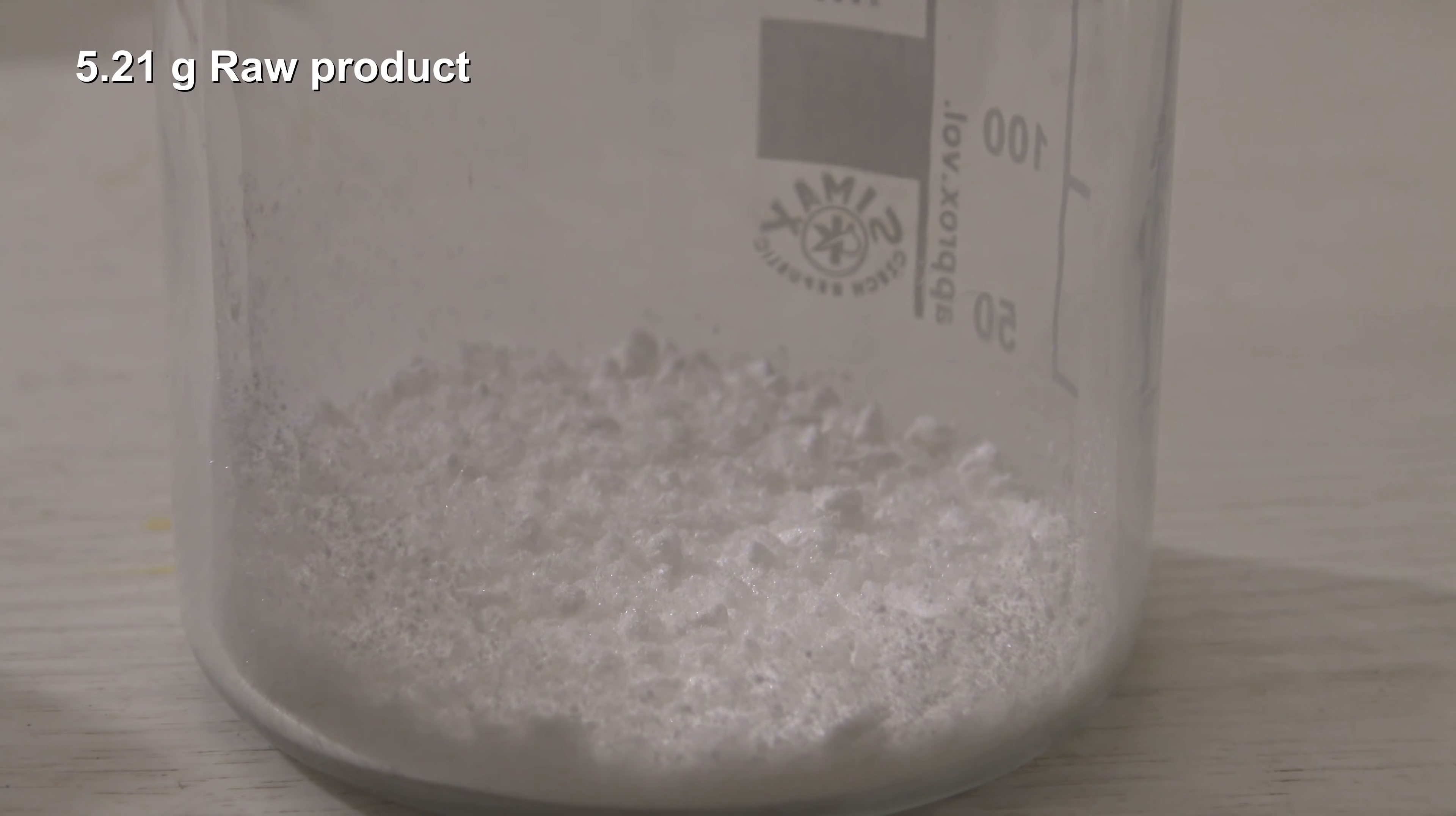5.21 grams of raw product were obtained, which was not dried completely because it had to be recrystallized.